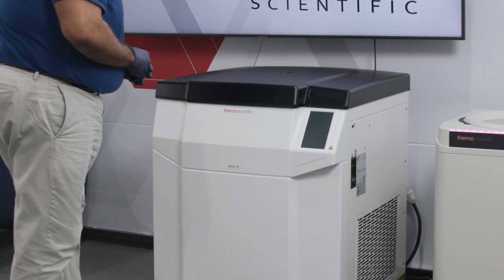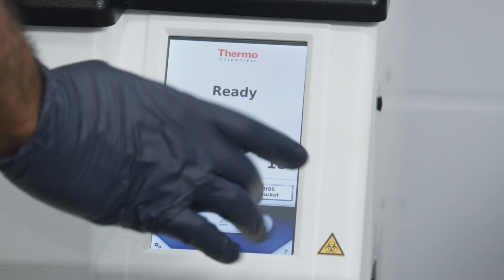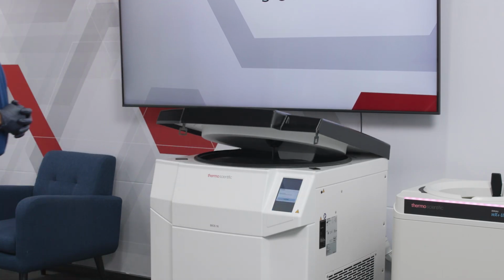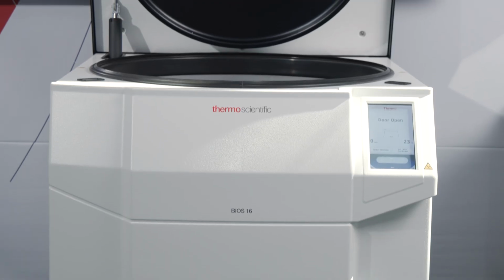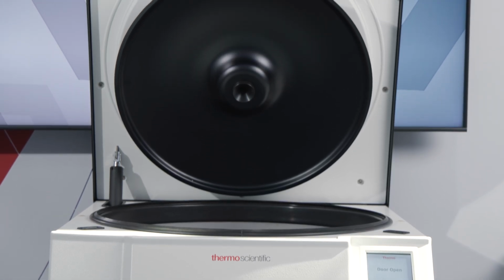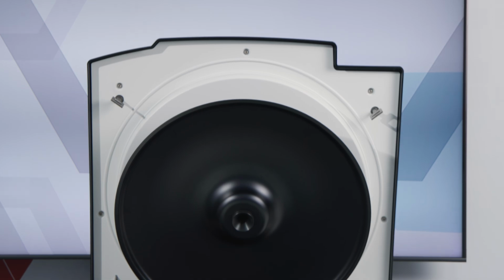While the centrifuge is booting up, the system checks its software and the touchscreen displays the Thermo Scientific logo. Next, press the open button on the touchscreen. The centrifuge door will automatically open using the Thermo Scientific auto door function. The centrifuge door can only be opened when the centrifuge is switched on. Do not use the mechanical emergency door release to open the centrifuge on a regular basis.